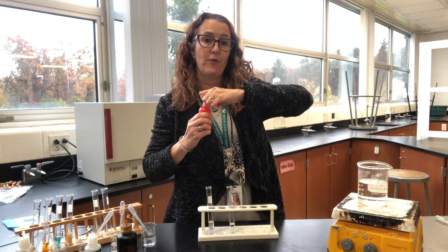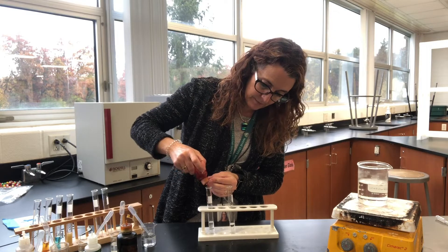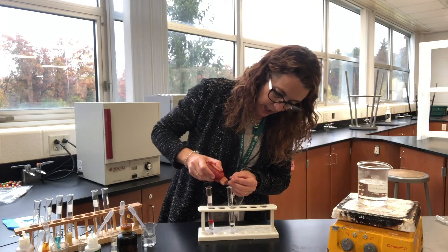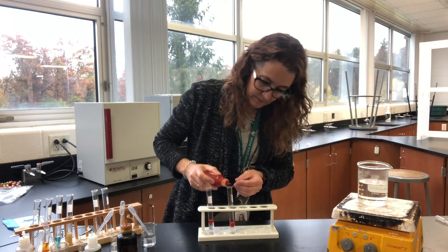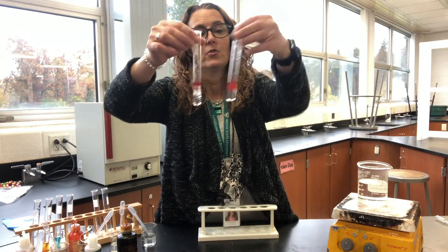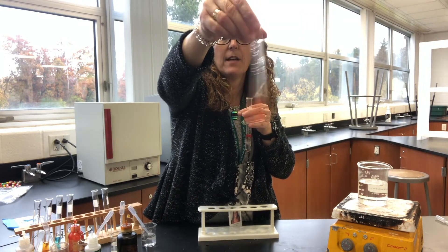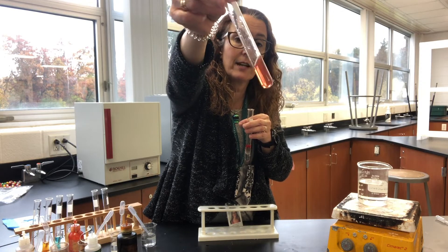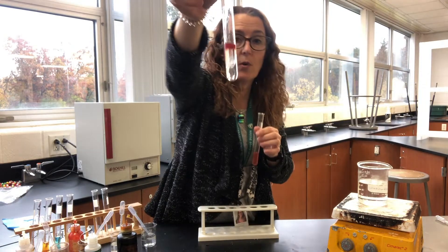I'm going to add a few drops of Sudan 3 to our oil and water mixture, and then a few drops to our plain water control, and give them a shake. With just plain water you can see the Sudan just mixes in very nicely and evenly — this is our negative result.